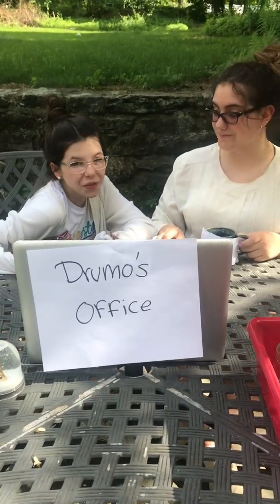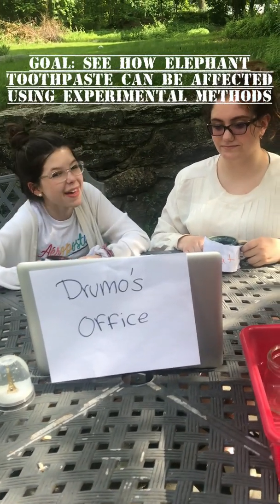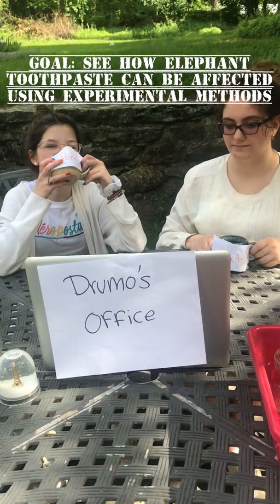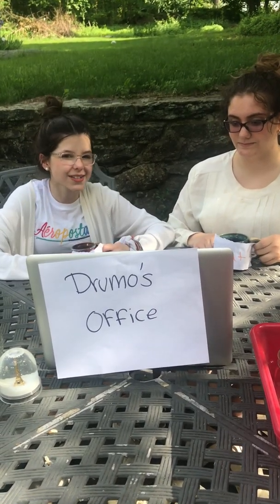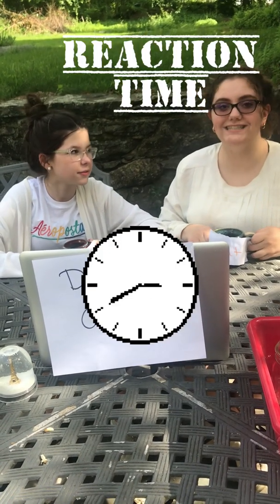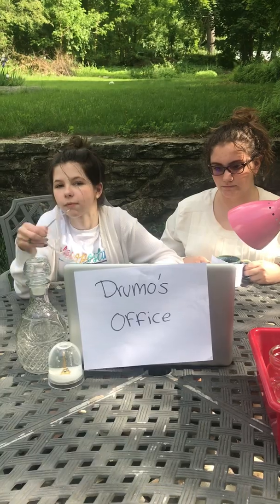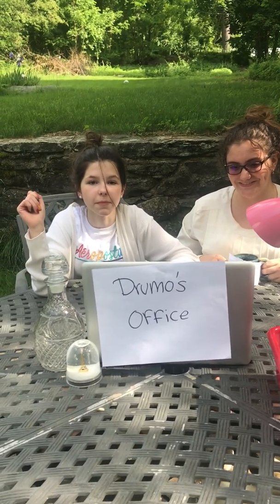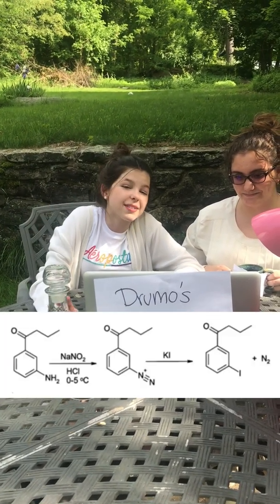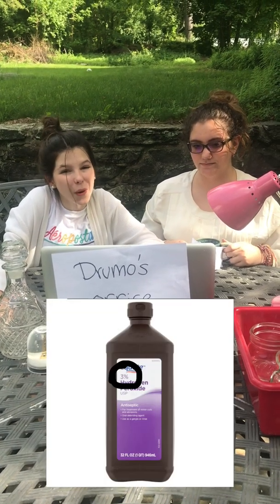Our overall goal for helping our friend is to use experimental methods to discover the different ways that elephant toothpaste can be affected. This will be tested by using height, reaction time, and how pretty it gets. The overall result of the experiment will vary depending on what catalyst we use, potassium iodide or yeast, and what percent hydrogen peroxide we use.